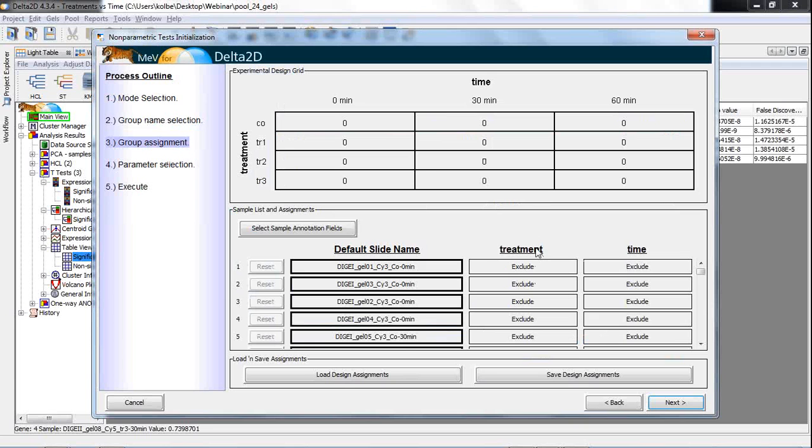Then you can see that we have now a table including the images, and then treatment and time as the two factors. Here on the top we can see that. And now I could just take the image and place it here. This image belongs to time 0 minutes and treatment control cell line. I can do this now with all the different images, which is, well, some clicks, but I have prepared that and I can just load these assignments as we can save the design assignments. So if you have once done all this assignment, you can save this design and load it again if you want to repeat the same test, maybe with another p-value or other different settings.